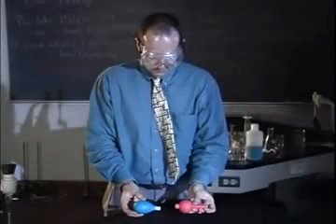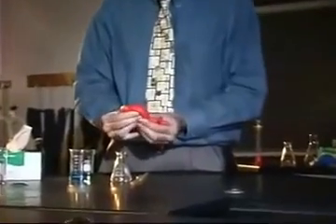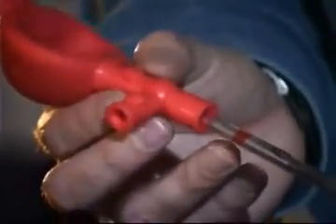Liquid is drawn into the pipette with one of two types of bulbs, never with your mouth. You risk ingesting chemicals and contamination of chemicals with saliva. The first bulb is operated by applying pressure to one of two valves. First, evacuate the air by squeezing the bulb. The first valve, marked with an up arrow, is used to draw in liquid, and the second valve, marked with a down arrow, is used to dispense liquid.